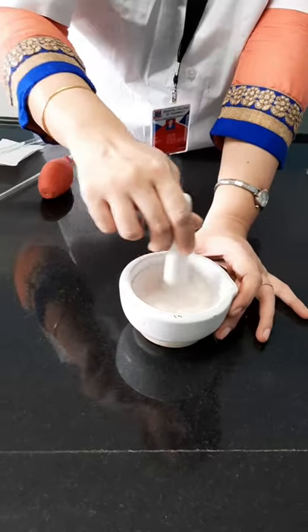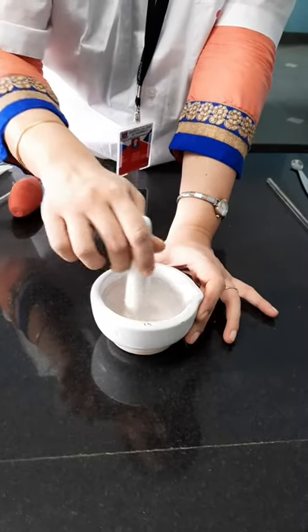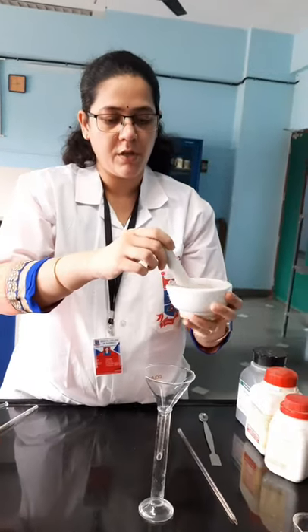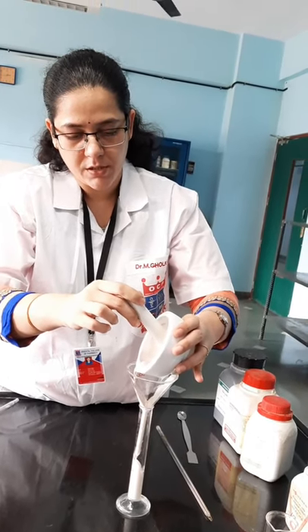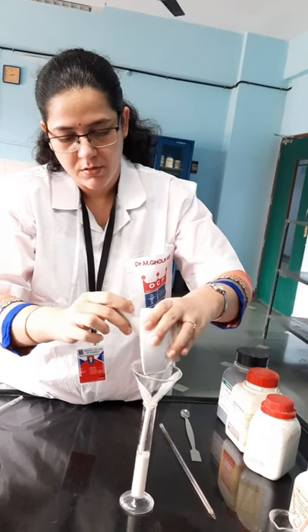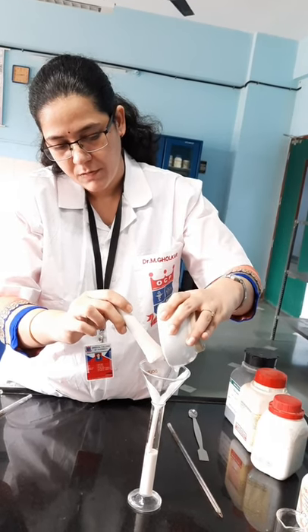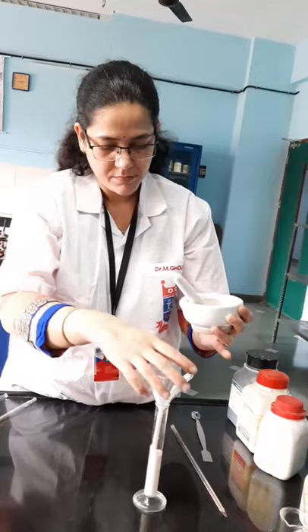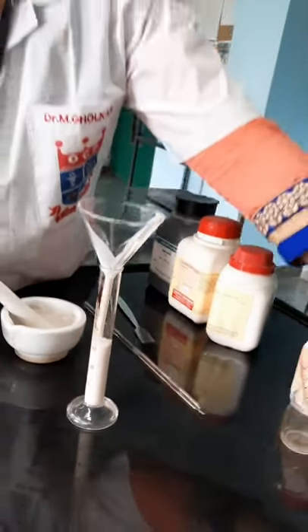We have finished adding glycerin and liquid phenol — please ensure that you have mixed the preparation properly. The last step is to make up the volume to the required 20 ml. I will transfer the entire suspension to a measuring cylinder. The volume is around 15 ml because we took 14 ml of water and added 1 ml glycerin and 0.1 ml of phenol.